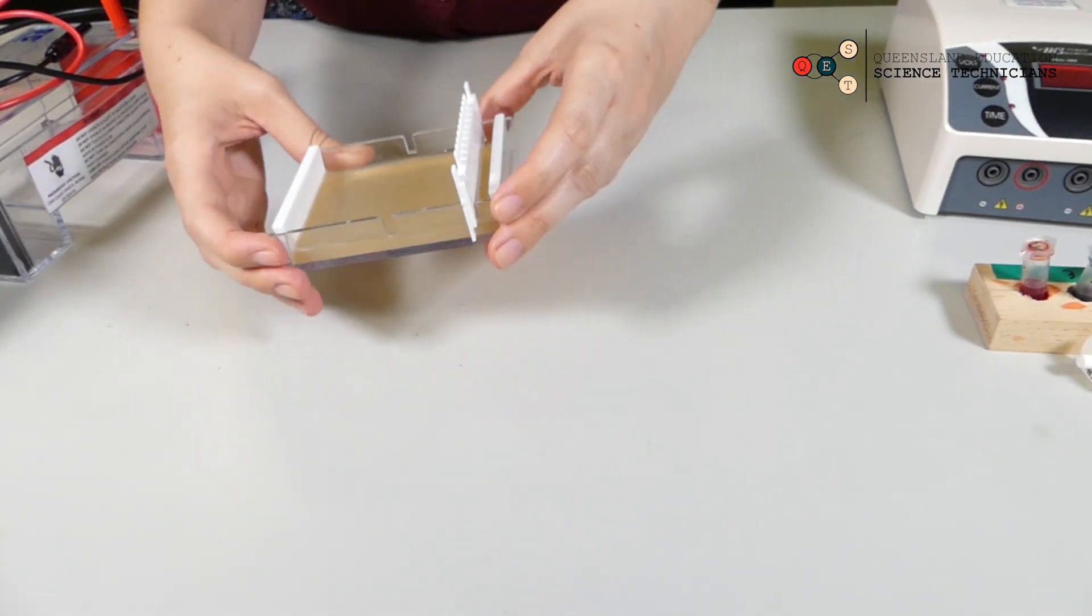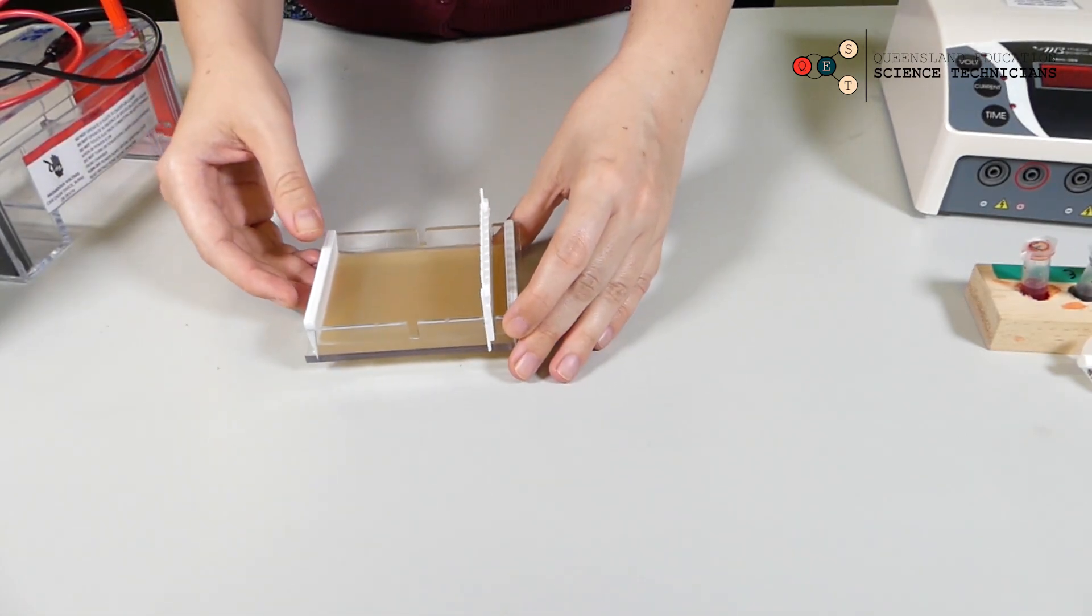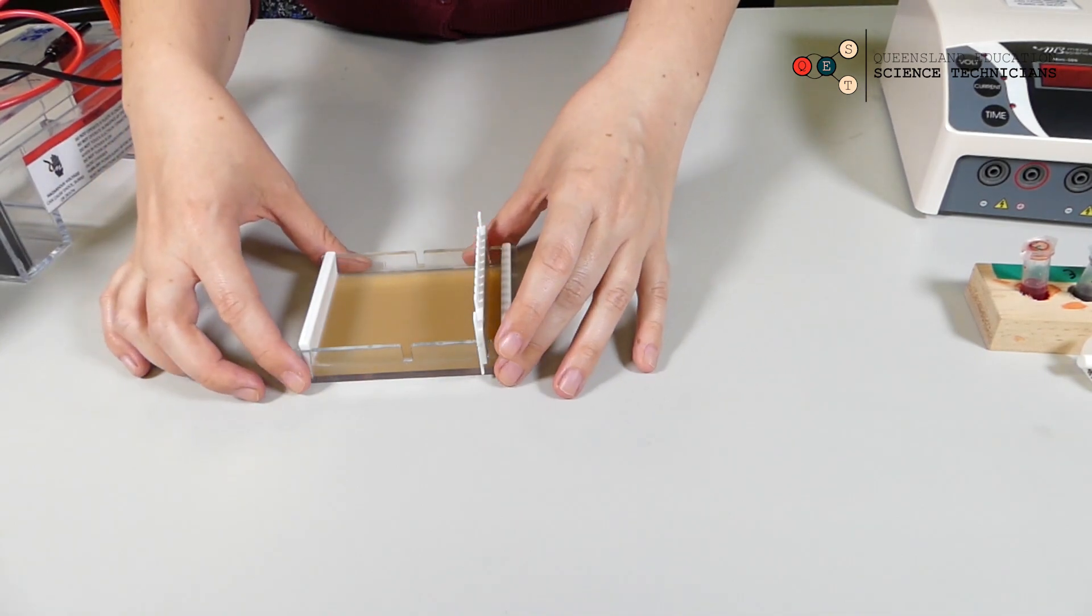Gel is set. Nice and cool, nice and solid. So we're ready for some gel electrophoresis.